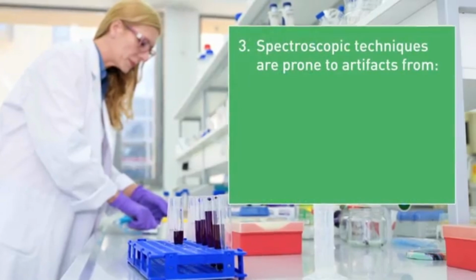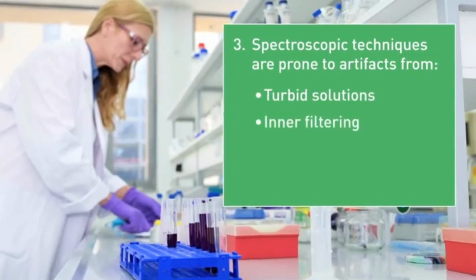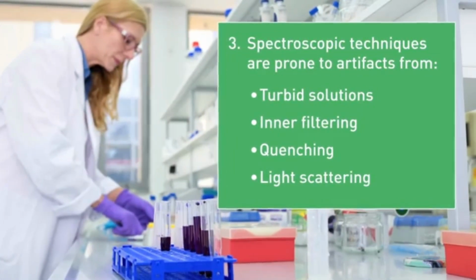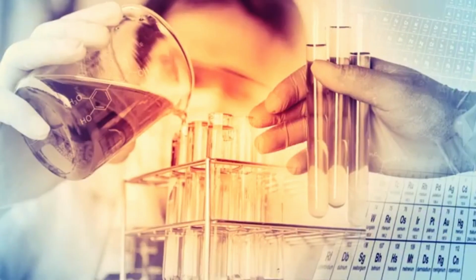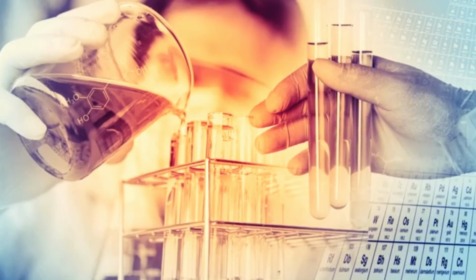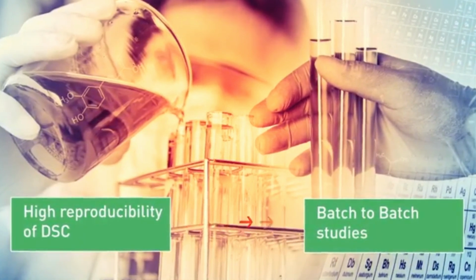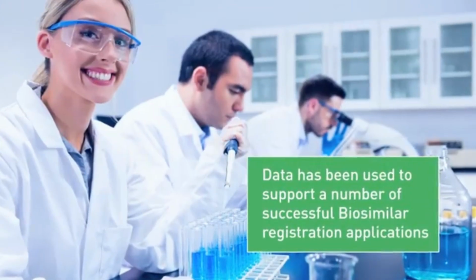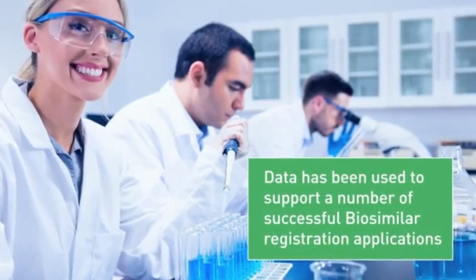Thirdly, spectroscopic techniques are prone to artifacts from turbid solutions, inner filtering, quenching and light scattering, which plague fluorescence measurements and are often dependent on sample concentration. These phenomena can also lead to poor reproducibility. It is the high reproducibility of DSC that has led to its use in batch-to-batch studies. DSC data has been used to support a number of successful biosimilar registration applications.